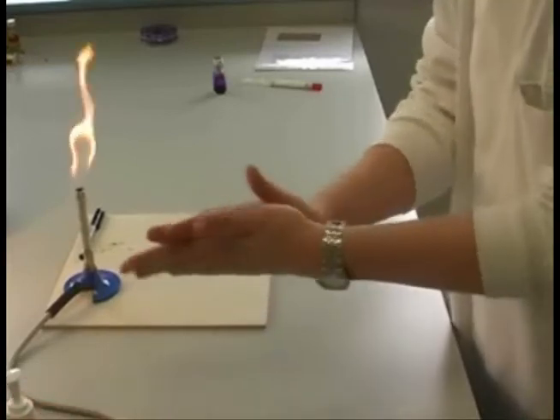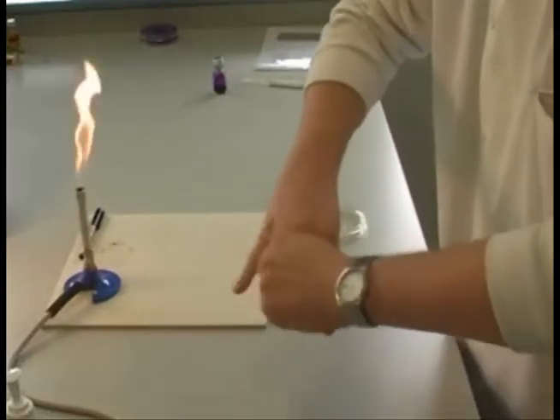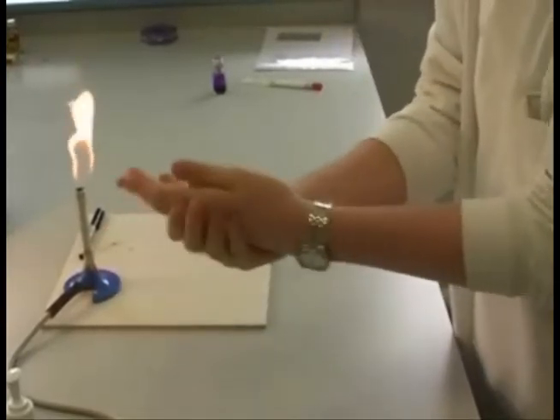In these practical sessions you will not be wearing rubber gloves due to the significant safety hazard of working near an open flame. Rather, you are required to wash your hands using the alcohol gel, remembering to practice proper hand wash technique and clean your hands thoroughly.